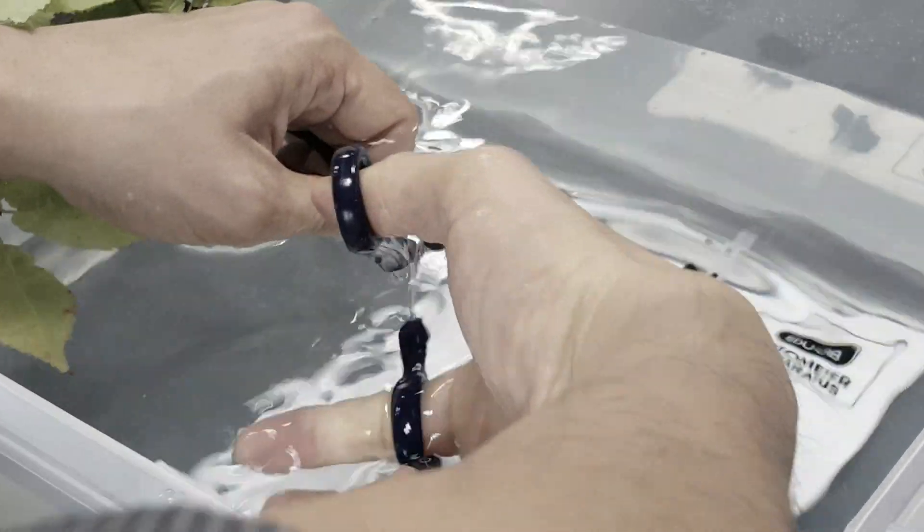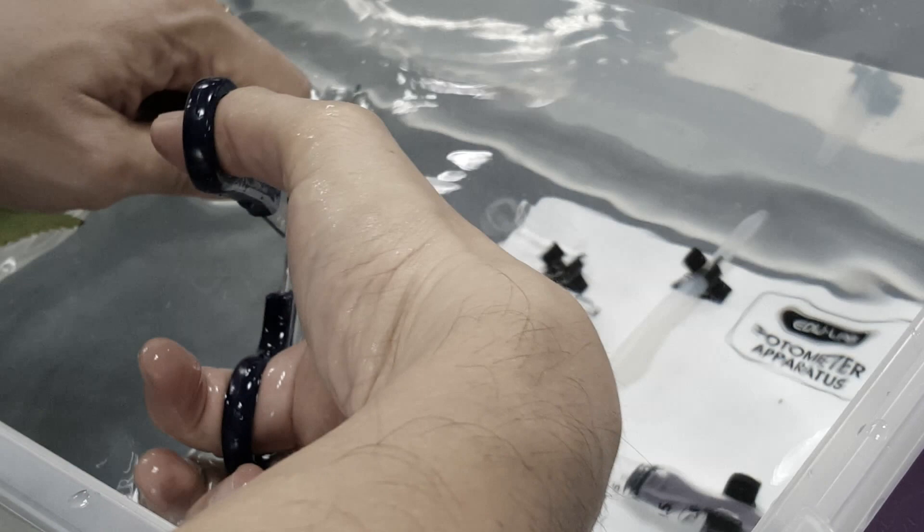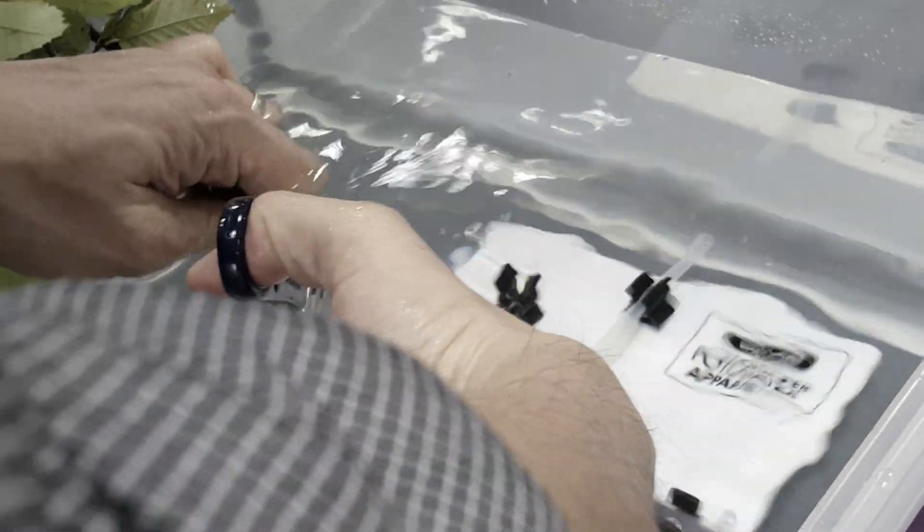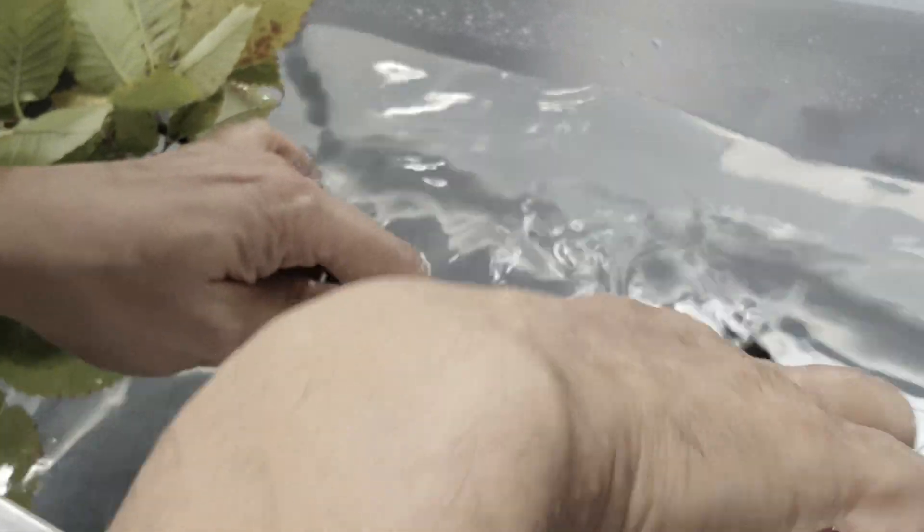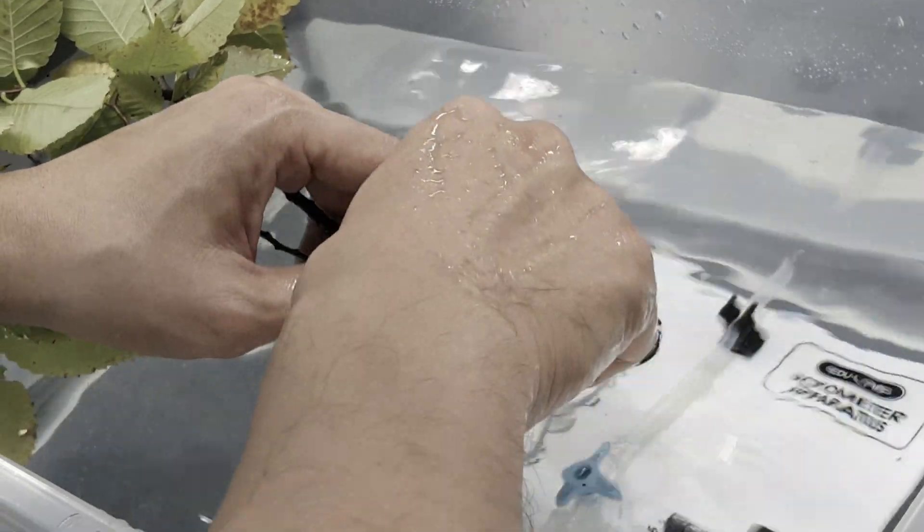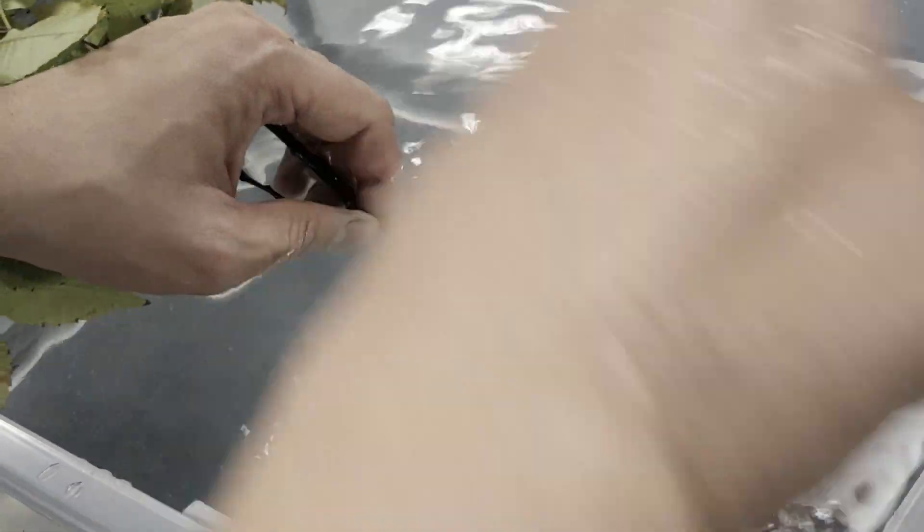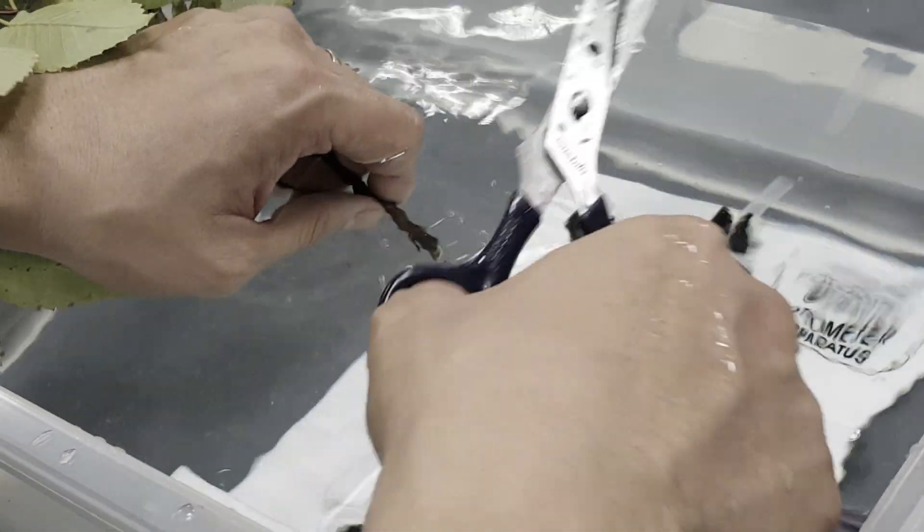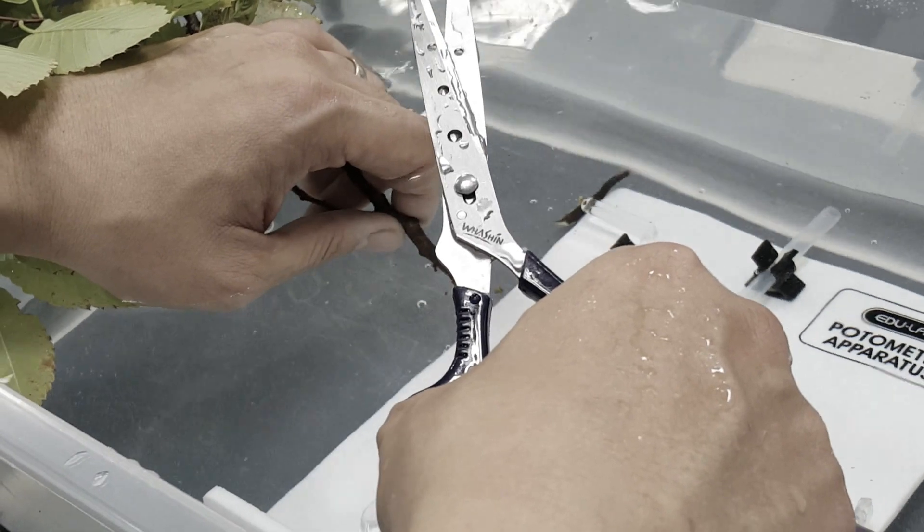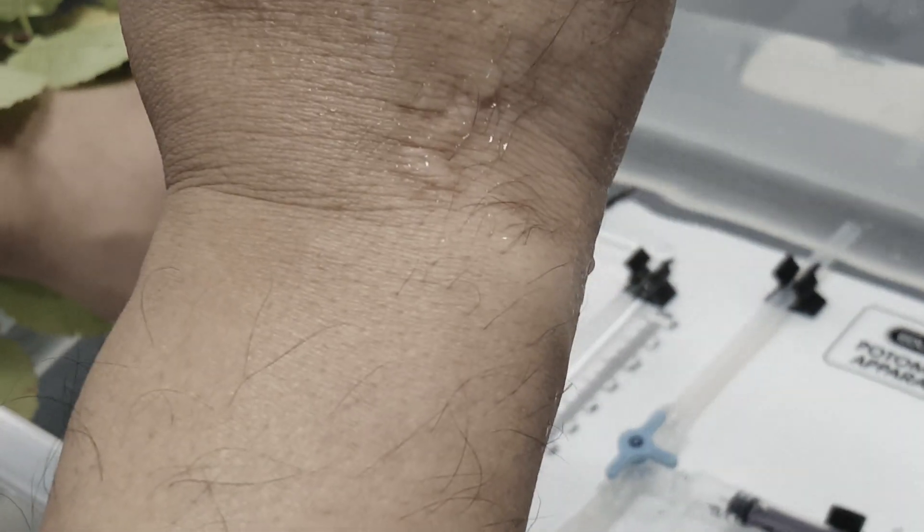The reason why you cut it underwater—and make sure Mr. Chang's hand doesn't get cut off with those gardening scissors—is because water has what property that allows water molecules to be close to each other or stay together? Cohesion. Cohesive property.